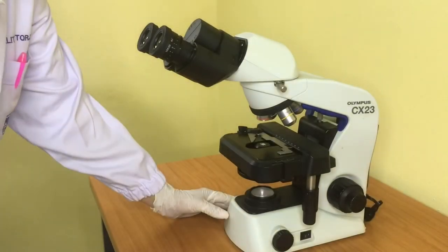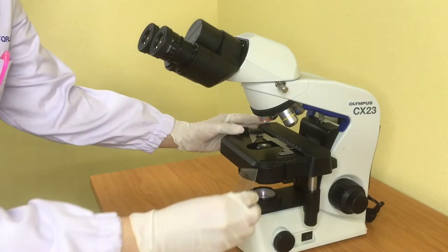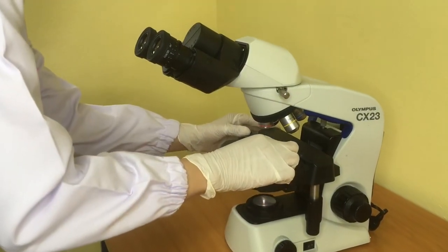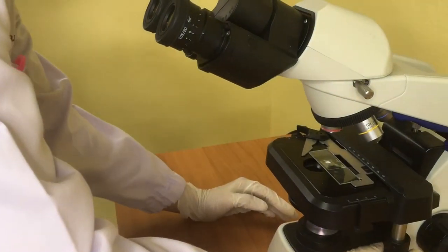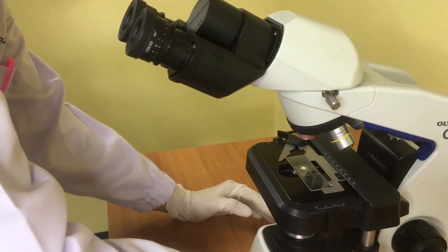When viewing a specimen under the microscope, you should place the slide on the stage and secure the slide using the stage clip.